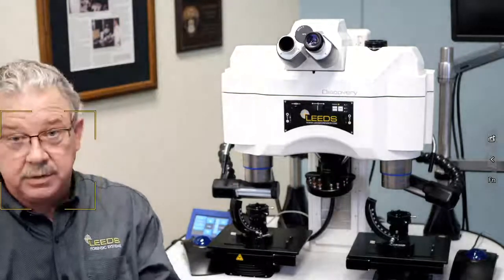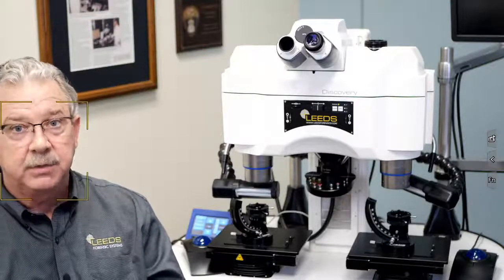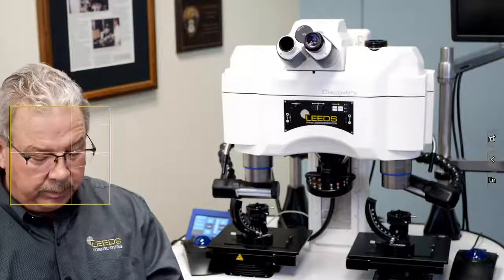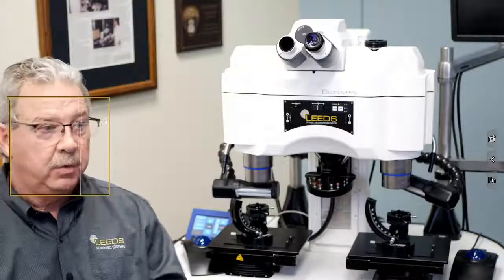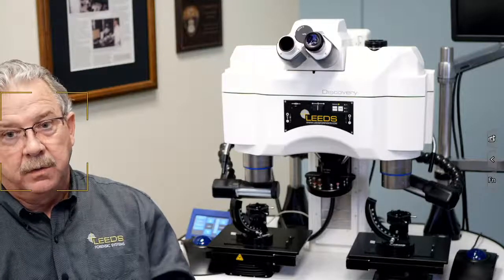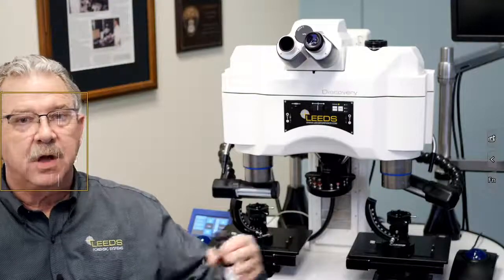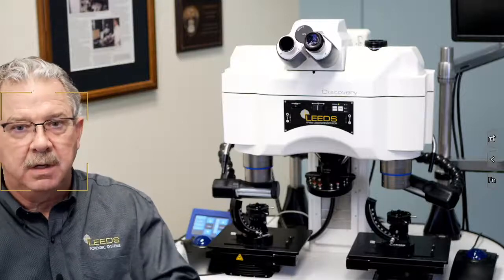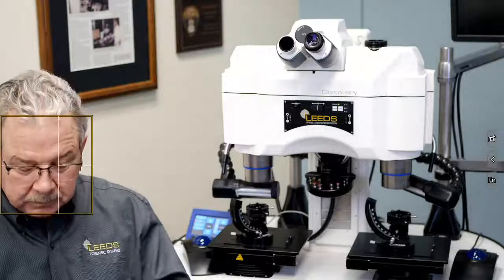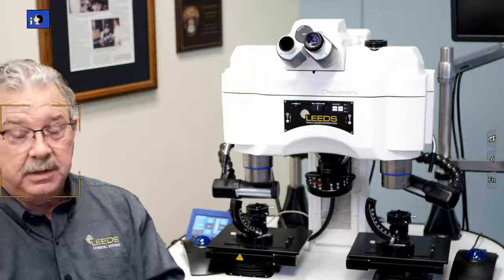Now, it has to be supported by the optics themselves, but the ring ultimately is what defines the edge of our field of view. We put that ring in there for a couple reasons. Number one, because it's a real image plane, and the human eye does not like our field of view to just sort of softly fall off the edge. We like to see a hard edge to our field of view. And so that's why they make a very nice sharp ring at that field plane inside the eyepiece.